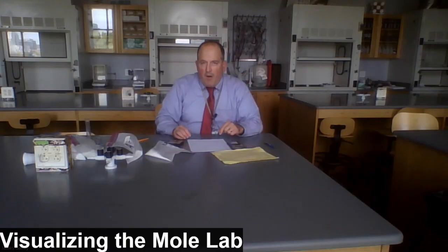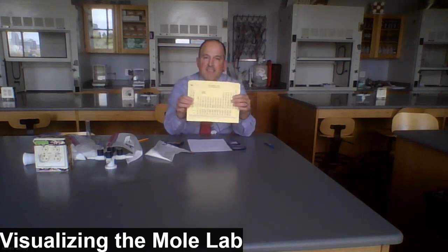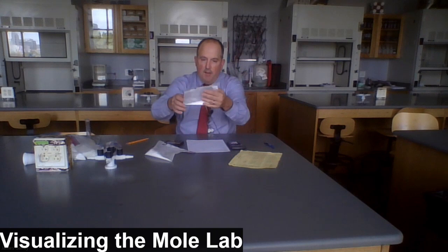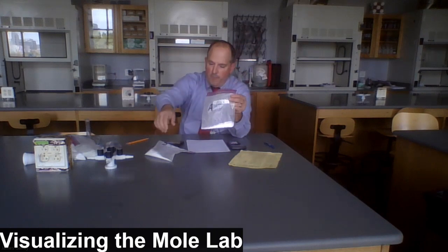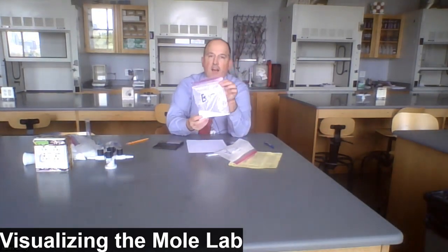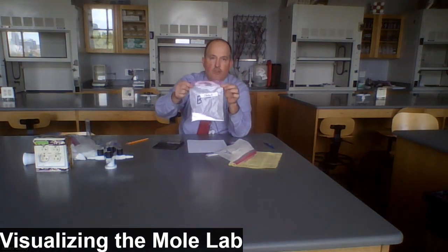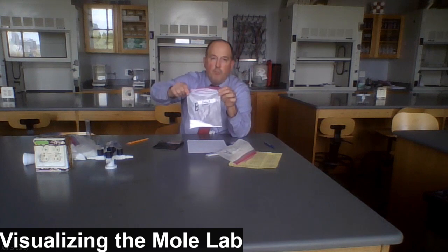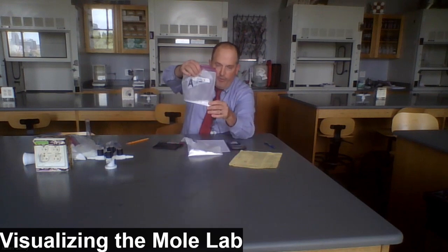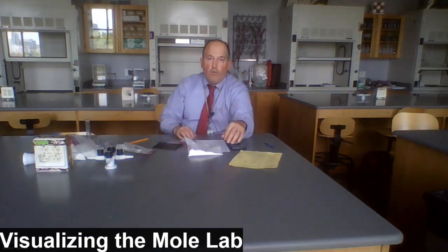We know that sodium bicarbonate's calculated molar mass from the periodic table is 84 grams per mole. Of our 2 samples, sample A was much less than that, 47.4 grams. And sample B was much closer, although not exactly the same. I got 79.9 grams. That is, sample B, therefore, is much closer to the actual molar mass of sodium bicarbonate. So we would conclude that sample A is not a 1 mole sample. It's much less than that. The mass of 1 mole of baking soda, 84 grams.